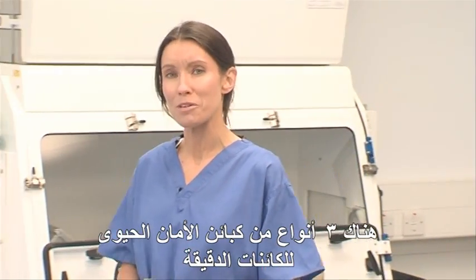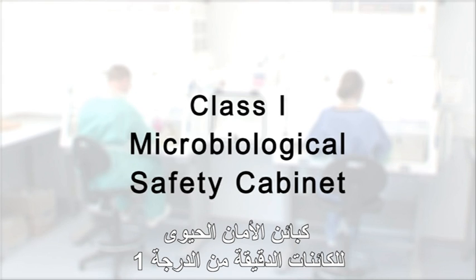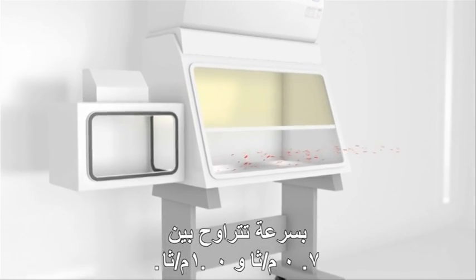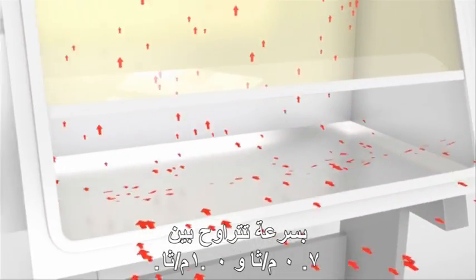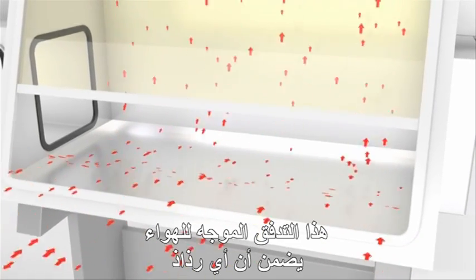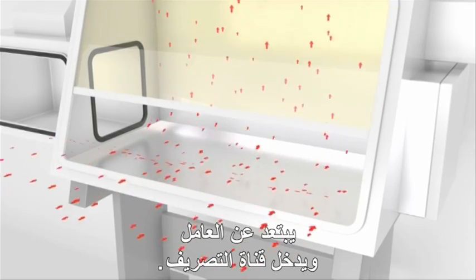There are three types of microbiological safety cabinets known as class 1, 2 and 3. In a class 1 biological safety cabinet, room air is drawn in through the front opening at a velocity of between 0.7 metres per second and 1 metre per second. It passes over the work surface and is discharged from the cabinet through the exhaust duct. This directional flow of air ensures that any aerosol particles that may be present on or around the work surfaces are taken away from the operator and into the exhaust duct.